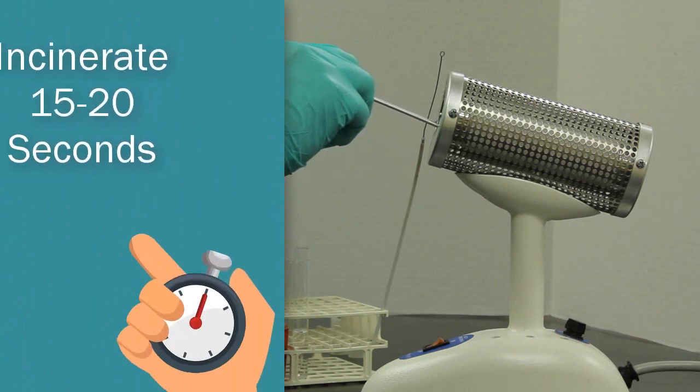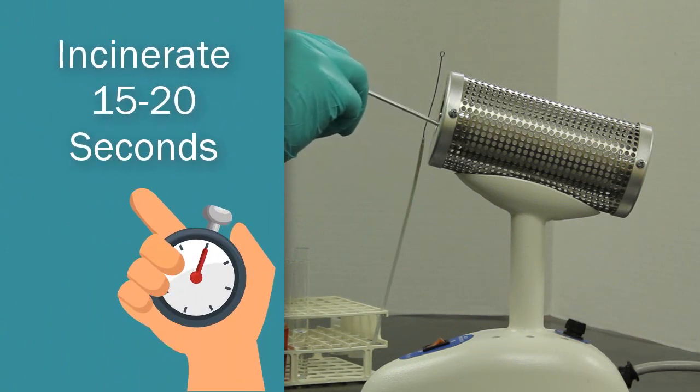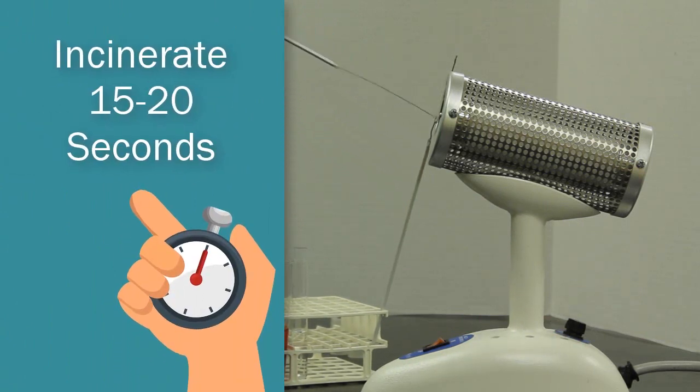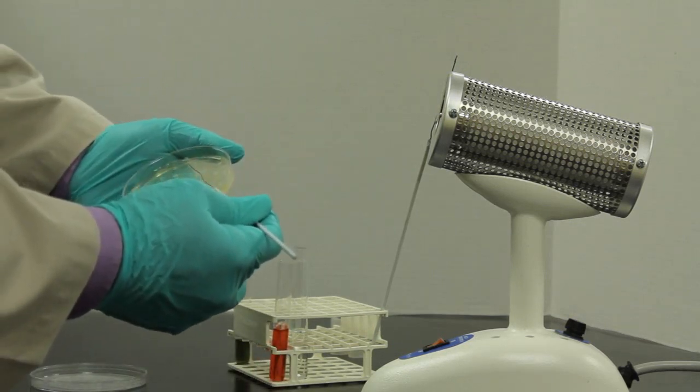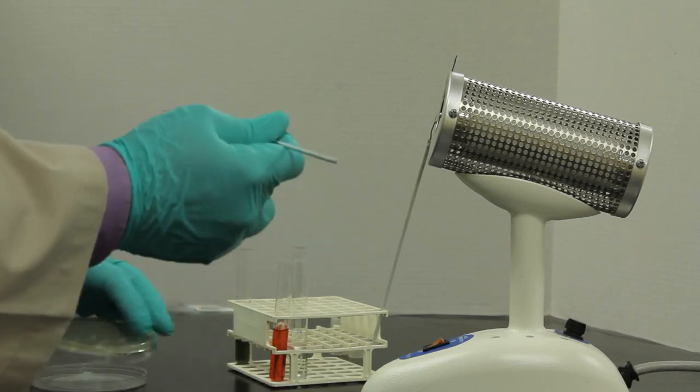Again, the needle goes into the incinerator for 15 to 20 seconds. When I'm ready, I'll pull it out. Let that cool for 15 to 20 seconds. Then I'll pick up an individual colony off of my plate.